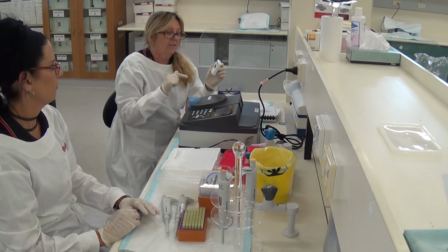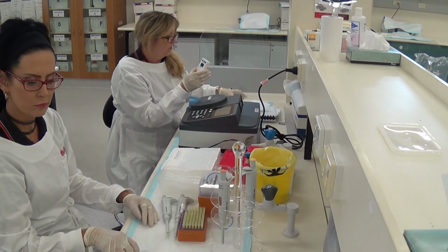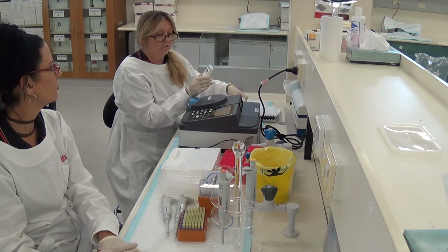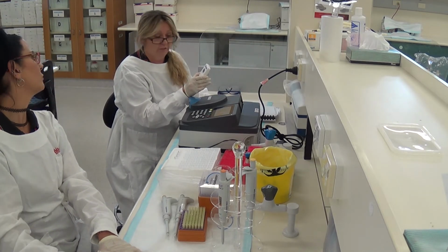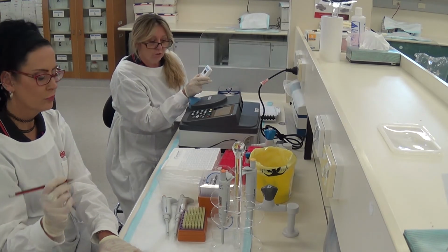We're now going to take the readings at every 30 seconds. At every 30 seconds, I want you guys to fill in this table. When it gets to the 30 seconds, I'll read out the number and I want you to fill it in. So 30 seconds: 0.231.